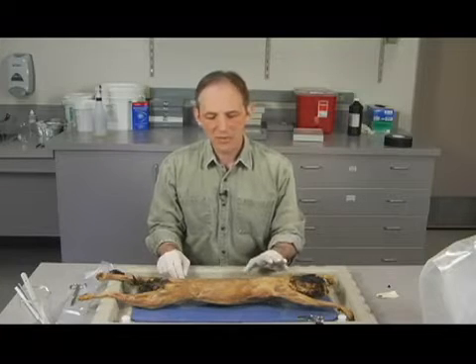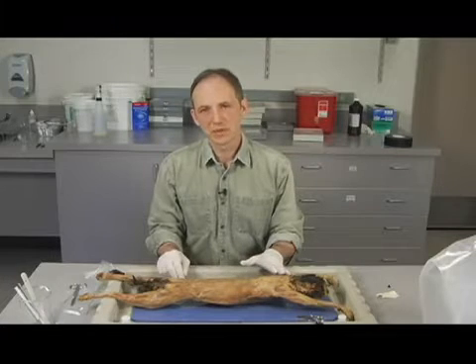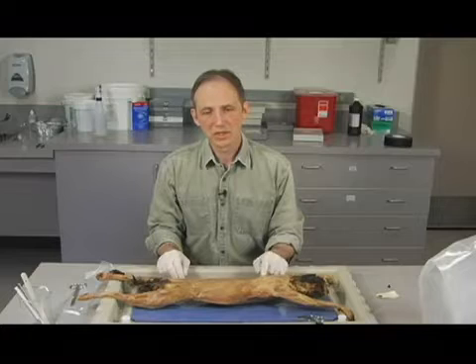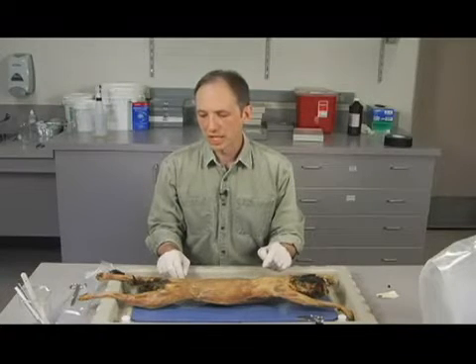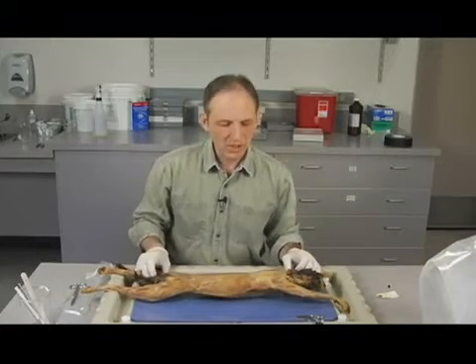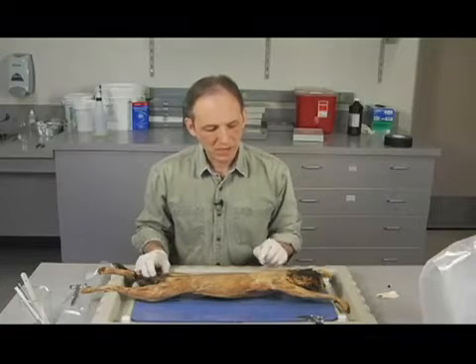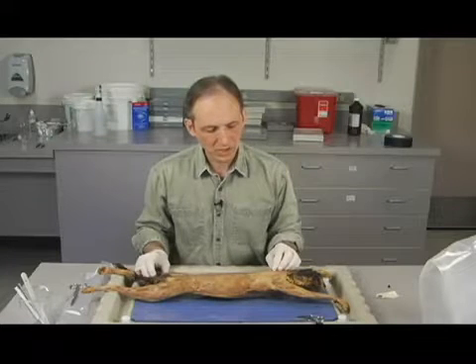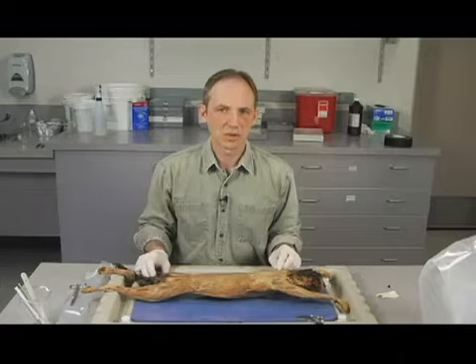The problem is that when you want to dissect to see muscles, for example, you have to remove enough of this tissue so that you can see the underlying muscles. So you actually have to remove some of this tissue. And we're going to be working on it. I decided that what we can accomplish in a little bit of time is to look at the area of the shoulder, and I'm going to demonstrate how we can do some tissue removal that will expose some of those muscles in the area of the shoulder.